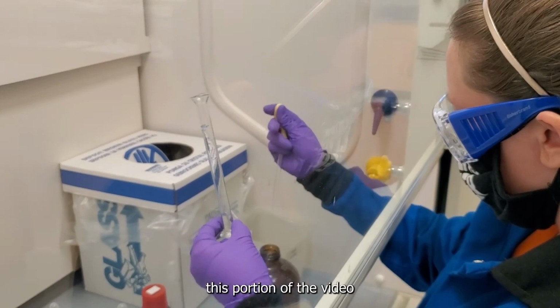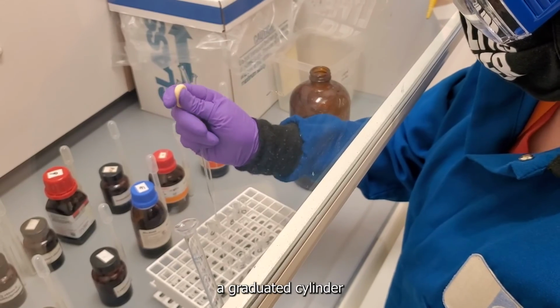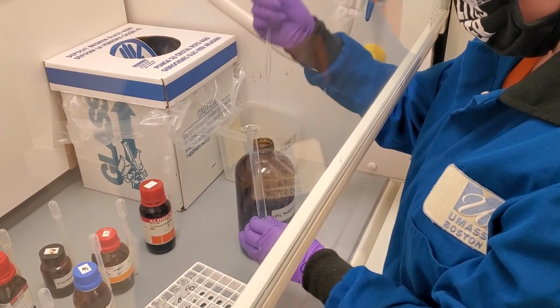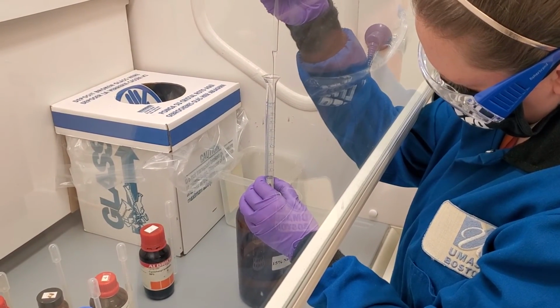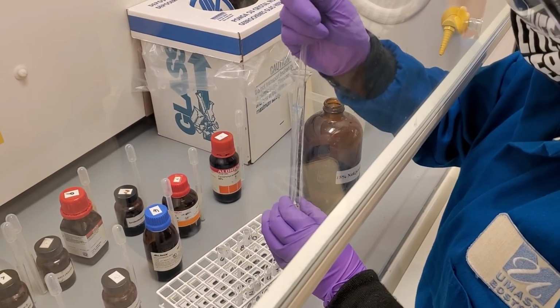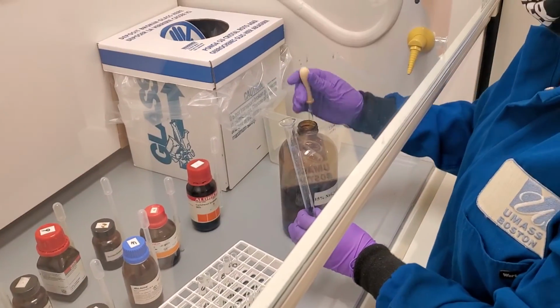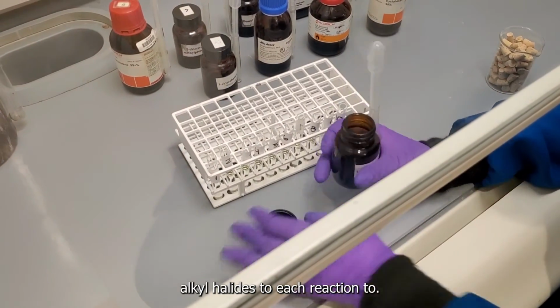Once again, I will fast forward this portion of the video as it's pretty straightforward. Note that she is using a graduated cylinder to do her measurements to ensure everything is accurate. Now with everything added, Tara is going to add the 4 drops of each alkyl halide to each reaction tube.